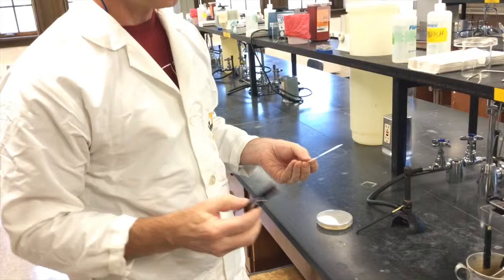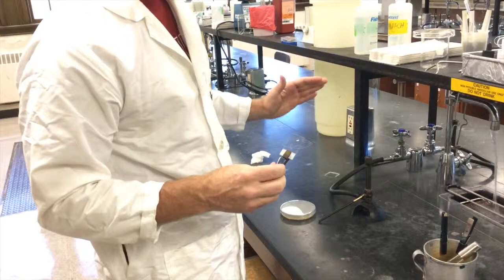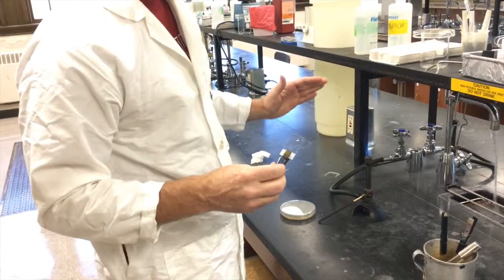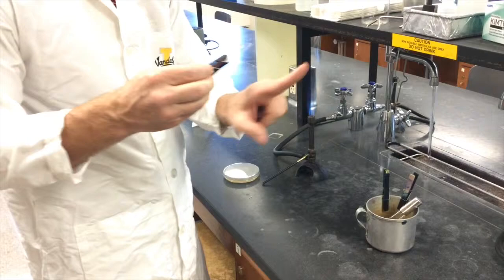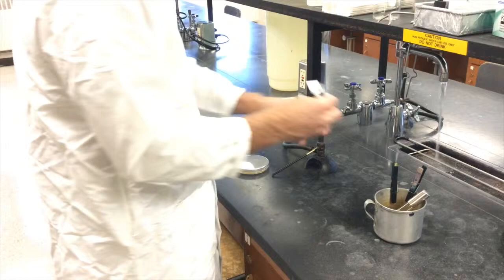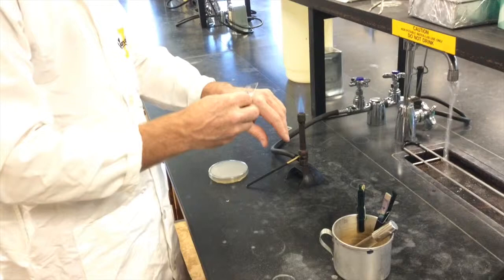You have these clothes pins. This will protect you from burning yourself when you're heat fixing it. So place your slide into the clothes pin. And when you're heat fixing it, you want to go rapidly because you do not want to burn yourself. You want to go lengthwise, not shortwise. Go through the flame. Go lengthwise. Touch your hand. Lengthwise. Notice how fast I'm going. Do not go slow. It's a good way to burn yourself. And you do this until it stings a little bit, uncomfortable, and you stop.